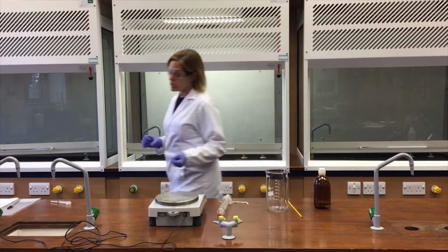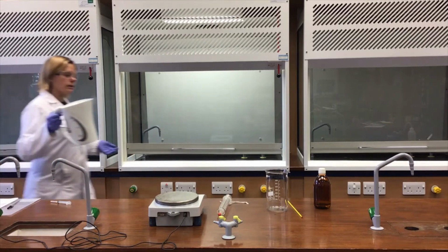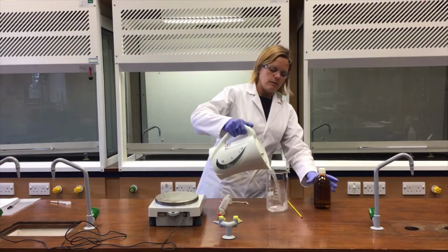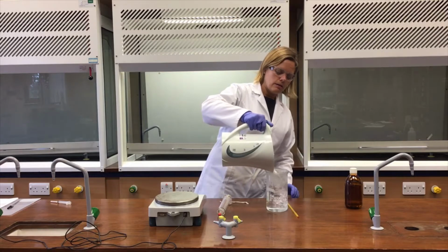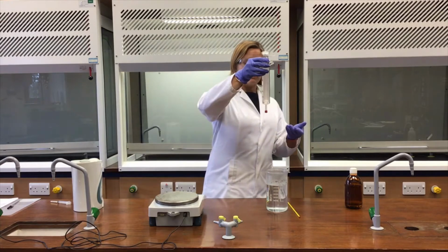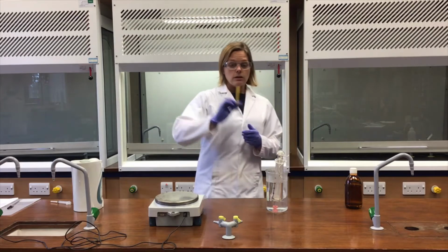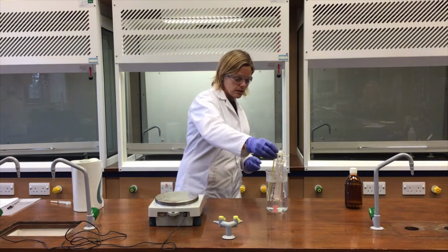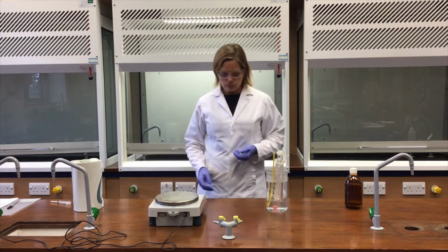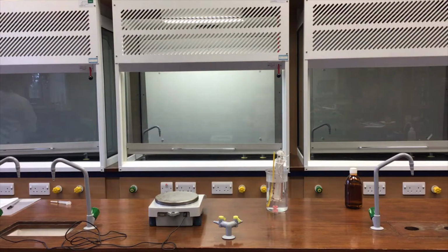The next thing I need to do is fill up that really tall beaker with some hot water from the kettle. So I've just freshly boiled this kettle and I'm just going to carefully pop some hot water in and get it pretty full so that as much of this gas syringe as possible is immersed in that water. I'm also going to use a thermometer now to just measure the temperature of that water, like so. And whilst that's working, I'm going to go and put the kettle back on in case we need to top it up in a moment. So I'll put the kettle back on here.